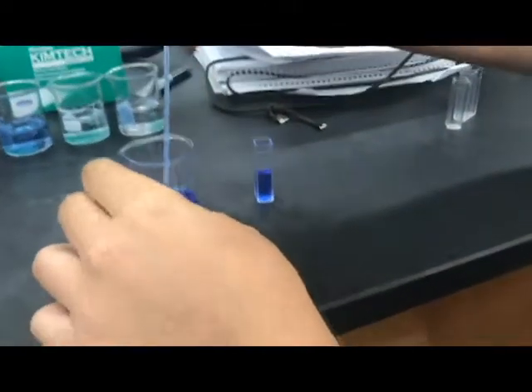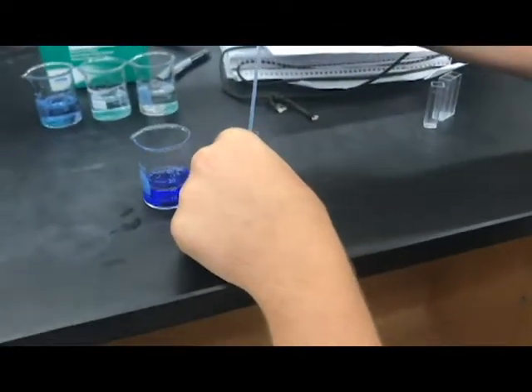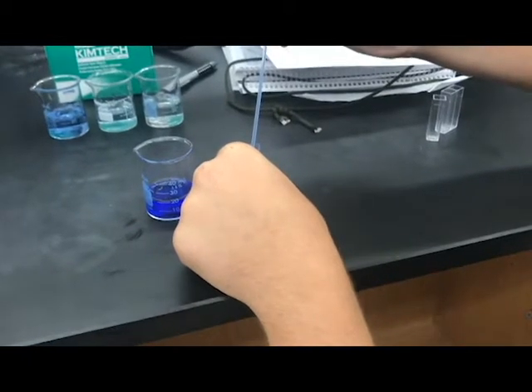After preparing solutions you're scanning, transfer sufficient but not excess solution to your cuvettes.